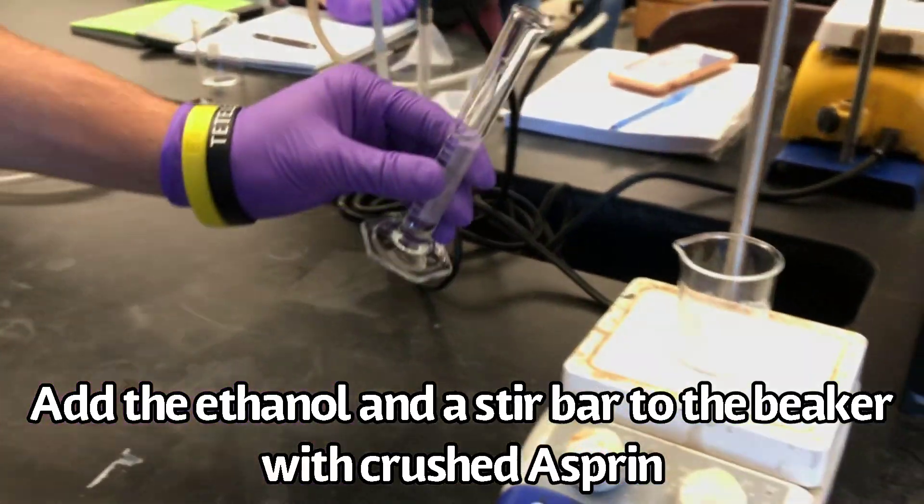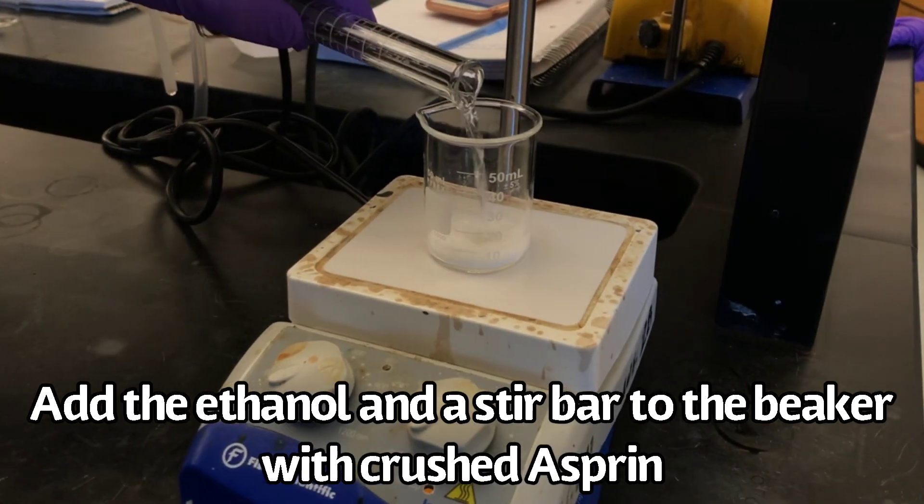Add the ethanol as well as a stir bar to the beaker with the crushed aspirin.